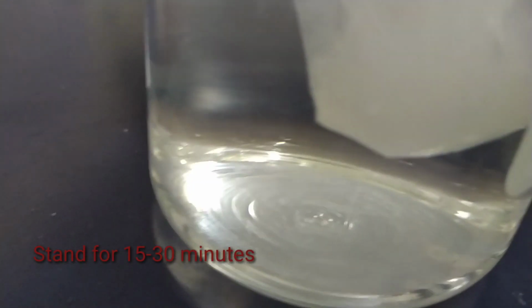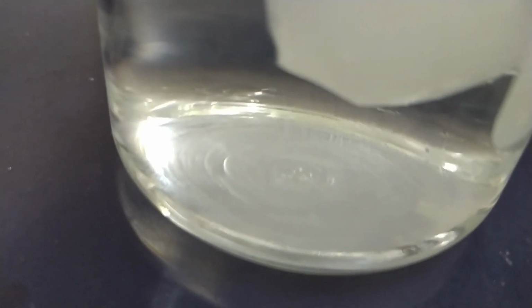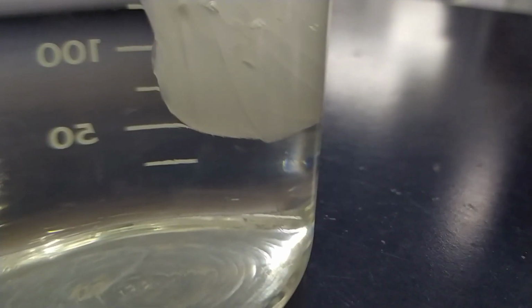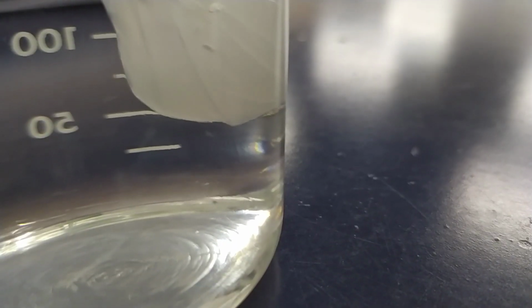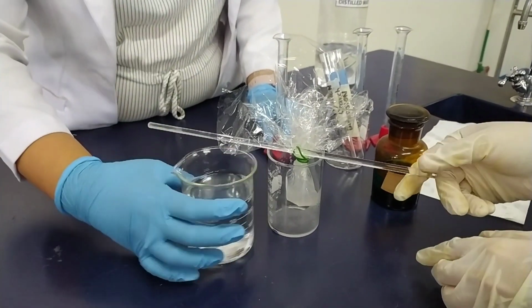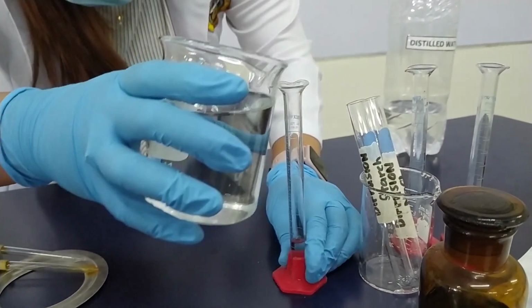Stand for 15 to 30 minutes. And then observe for diffusion. And then you have to test the water in the beaker for starch and sodium chloride. So you have to repeat what you did in procedure letter A.